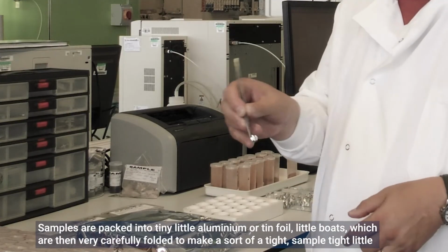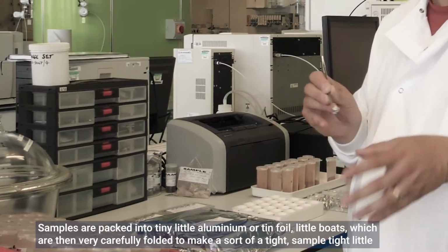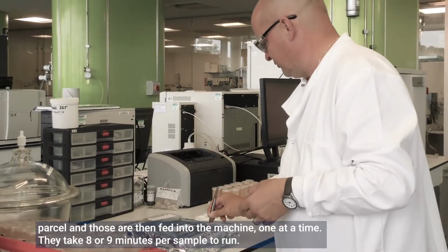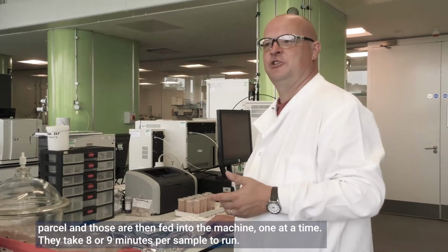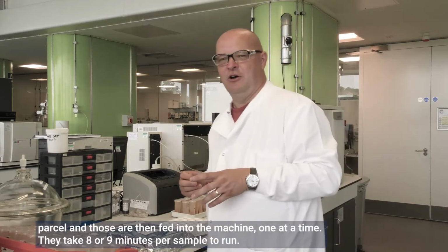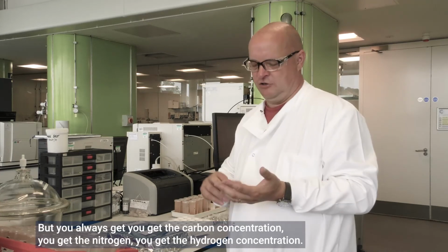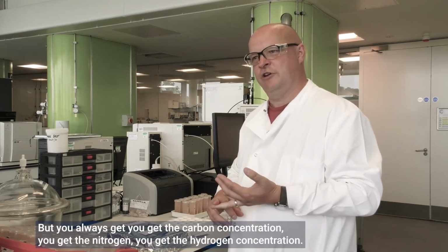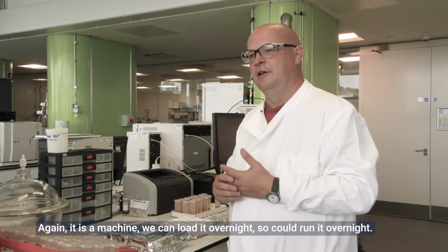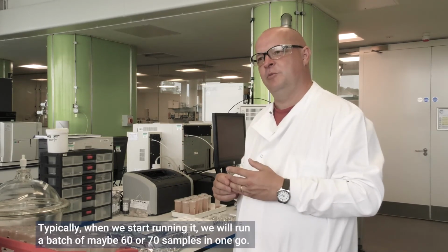Samples are packed into tiny little aluminium or tin foil boats, which are then very carefully folded to make a tight, sample-tight little parcel. And those are then fed into the machine, one at a time. They take 8-9 minutes per sample to run, but you always get the carbon concentration, the nitrogen, and the hydrogen concentration. Again, it's a machine, we can load it overnight, so we can run it overnight. Typically when we start running it, we'll run a batch of maybe 60, 70 samples in one go.